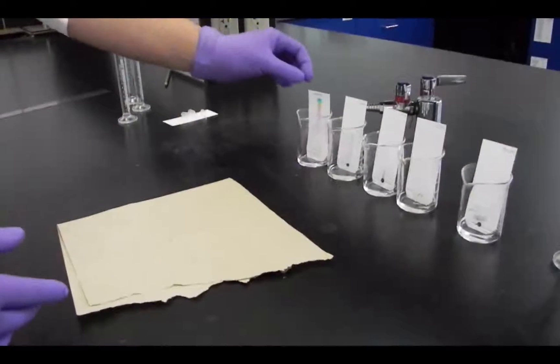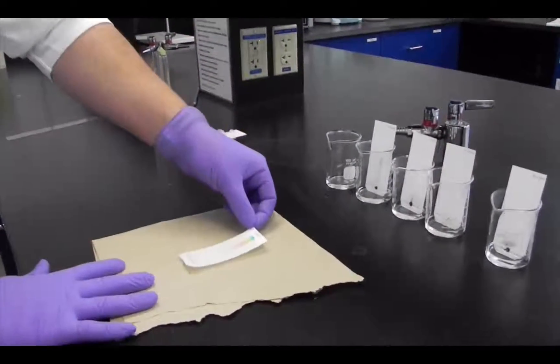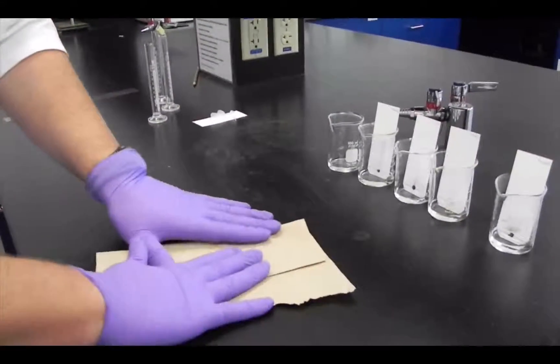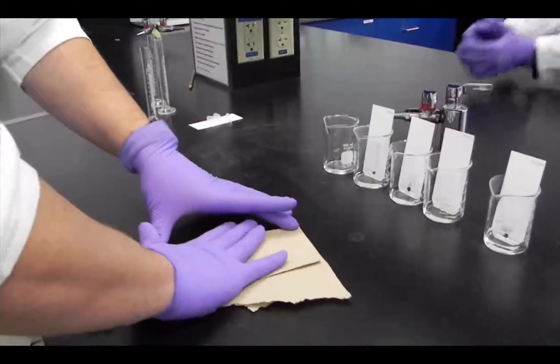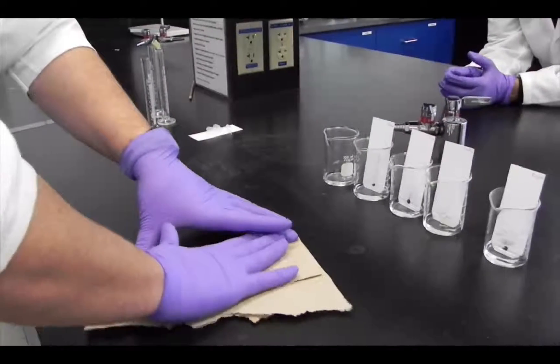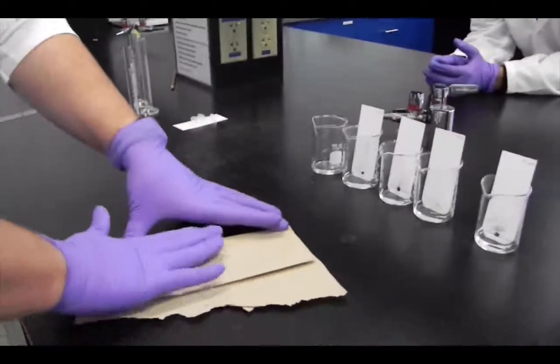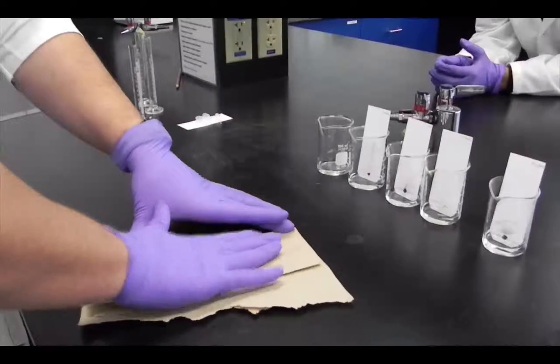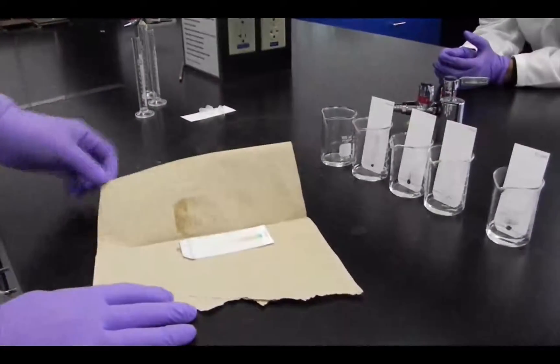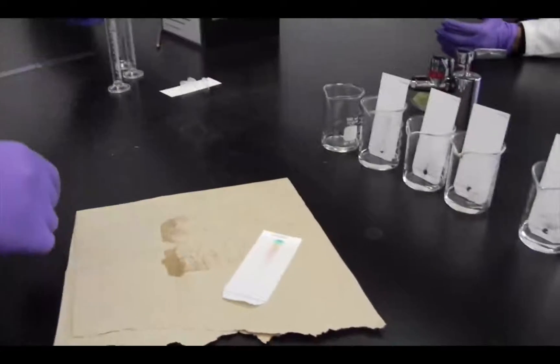Now it's enough height for the water. Take the paper, put it on a paper towel, then fold the paper towel on it and gently press with your fingers. This dries the extra water on the surface and the water stops moving up on the paper. You'll see all the extra water has been sucked up by the paper towel.